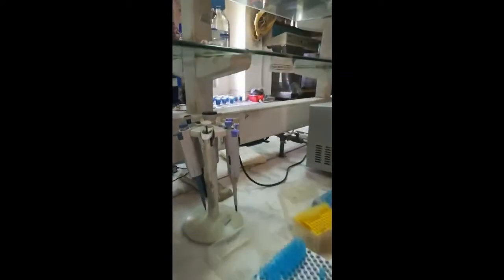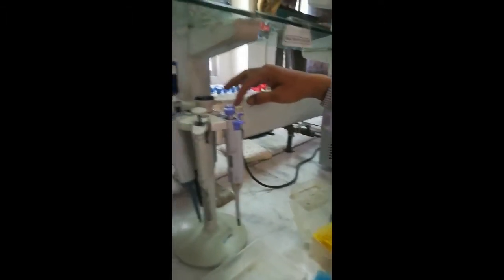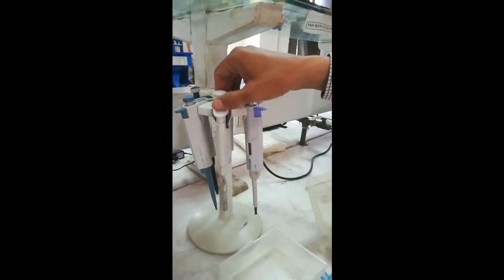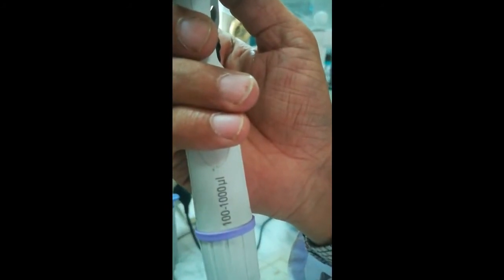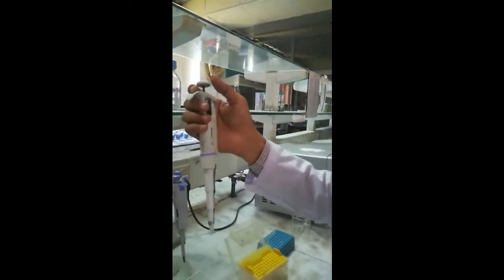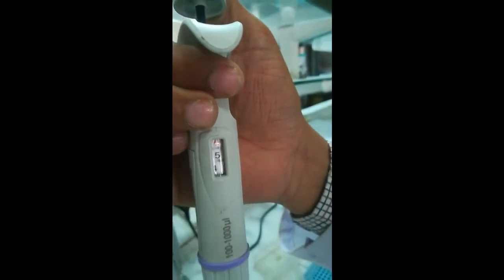Several micro pipettes are present here, each with different volume capacities. The largest one has a capacity of 100 microliter to 1000 microliter. Since 1000 microliter is equivalent to 1 ml, we can use this pipette for a maximum capacity of 1000 microliter or 1 ml.